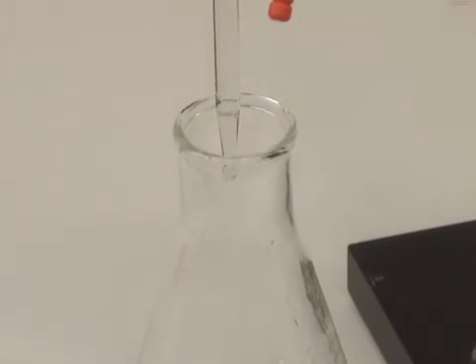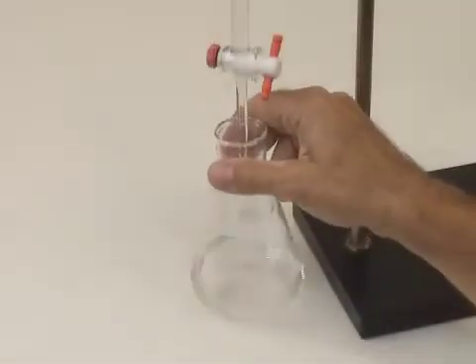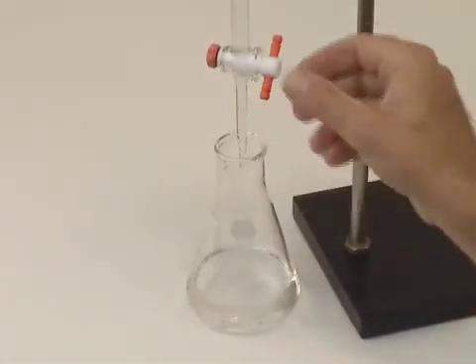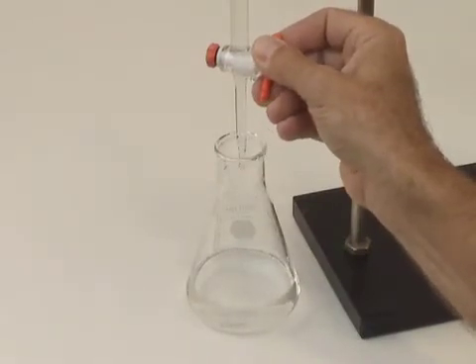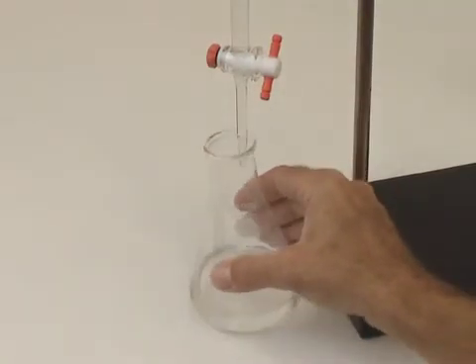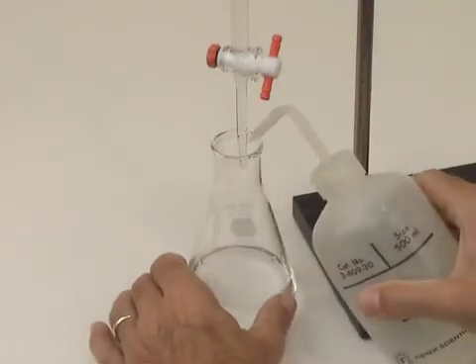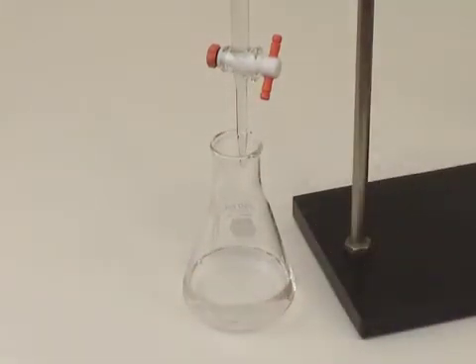Suspend the half drop from the tip of the burette, touch it to the side of the Erlenmeyer, and then rinse it down with your wash bottle. If you look carefully, you'll notice as we approach the end point that the pink color persists for a longer and longer time and occupies a larger and larger volume in the solution.